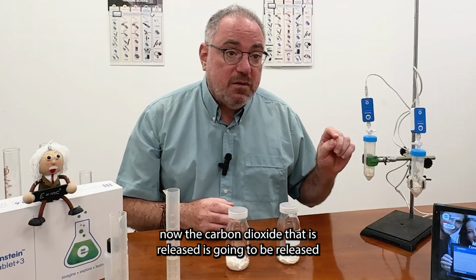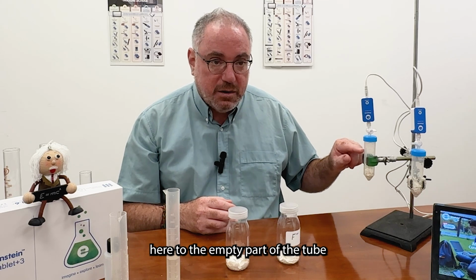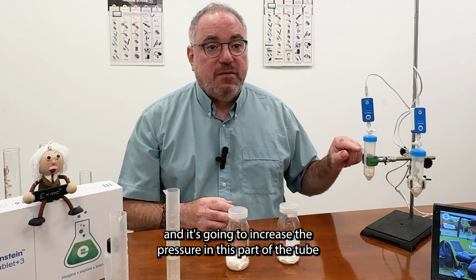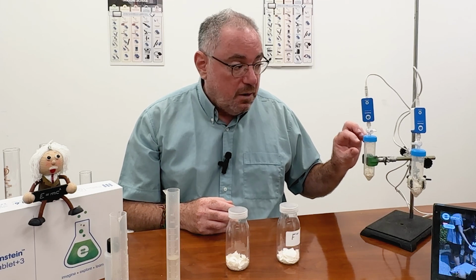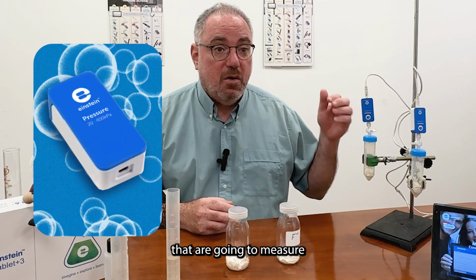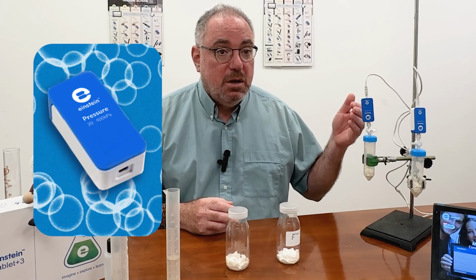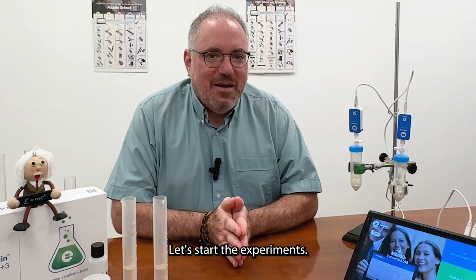Now, the carbon dioxide that is released is going to be released here to the empty part of the tube and is going to increase the pressure in this part of the tube. This is why I have here some pressure sensors that are going to measure or detect the increase in pressure in the tube. Let's start the experiment.